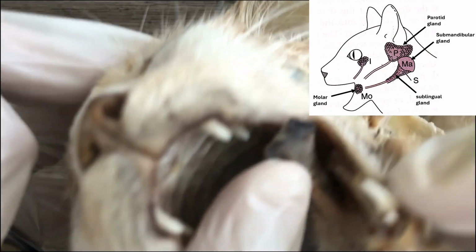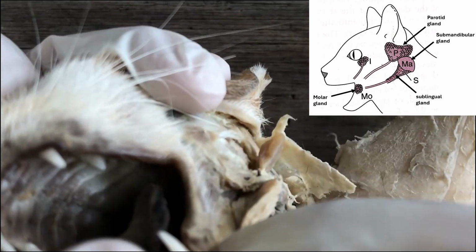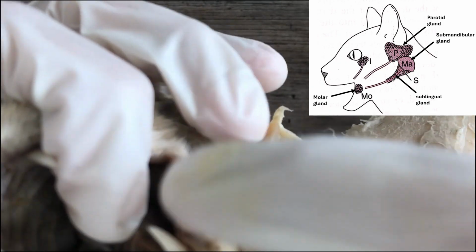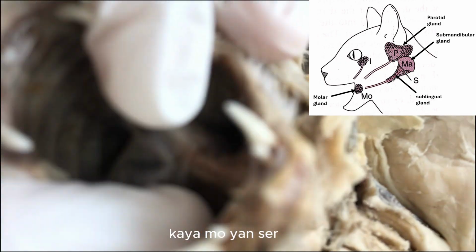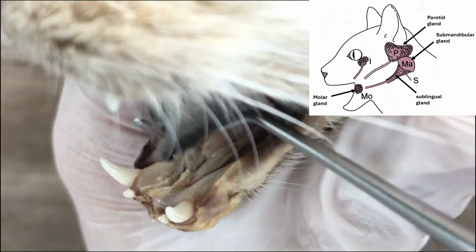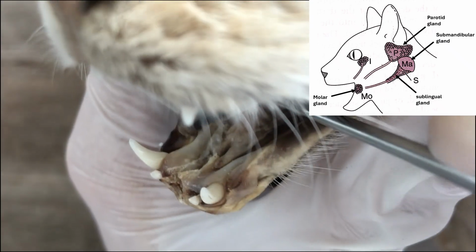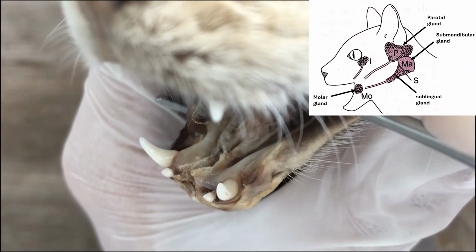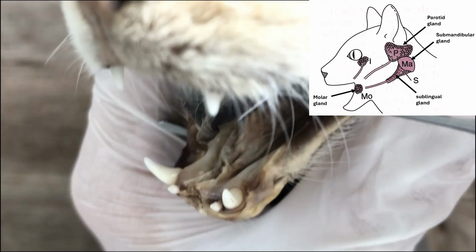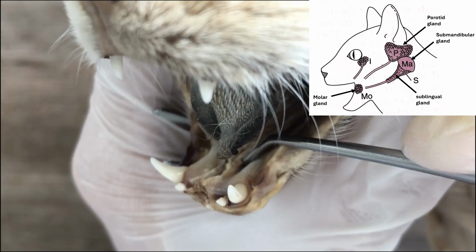If you lift it, and look, so there, so we're at the base of the tongue, and there are two papillae there, two little knobs, anterior region of the jaw.